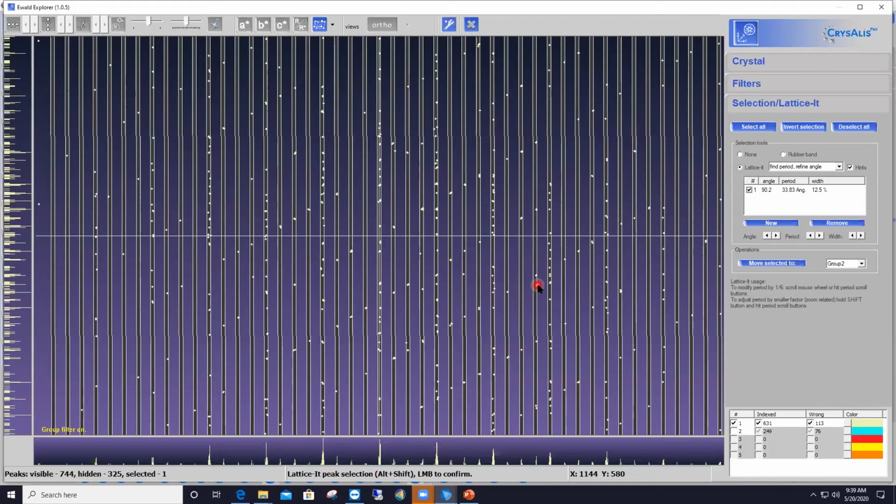And the program thinks as a result that these are legitimate rows and selects them and selects those reflections within the rows. But again, I know as a crystallographer that this is not correct, that the rows of reflections that belong to the first component of my diffraction pattern are those that are fully populated, this one here and that one there. So I need to get rid of these three intermediate rows. And to do that, I will basically increase the distance or the period in between consecutive rows.